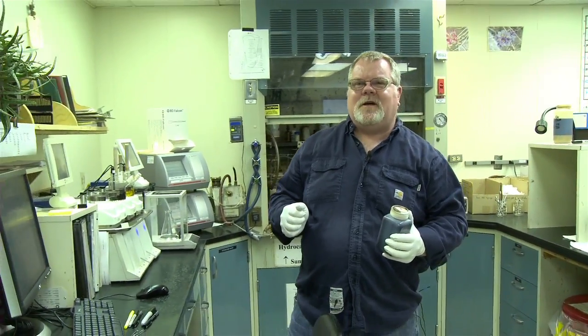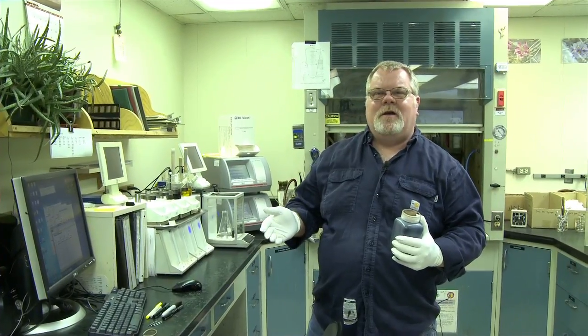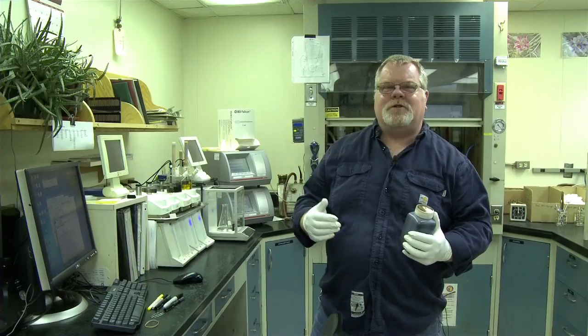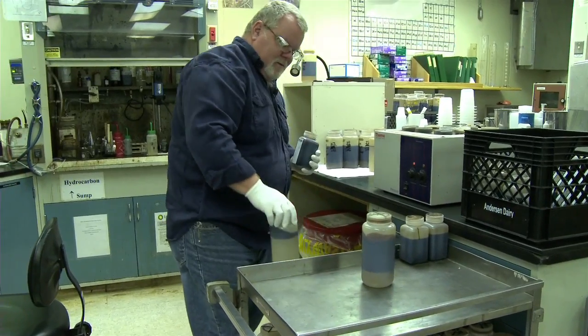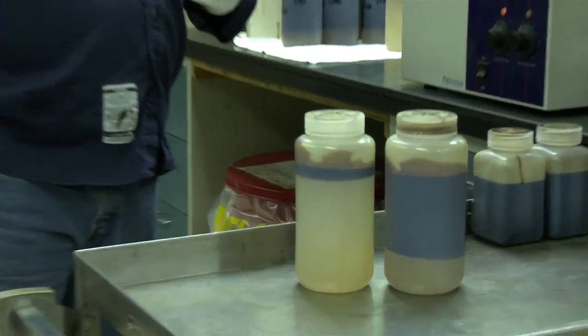I'm Tim Fitzgibbon, oils chemist in this area, along with my alternate who's off slope. So in this area we do oils analysis, a lot of water cuts, how much water is the well producing, produced water versus how much crude. A good example of that would be, that's a relatively low water cut and that's a relatively high water cut.